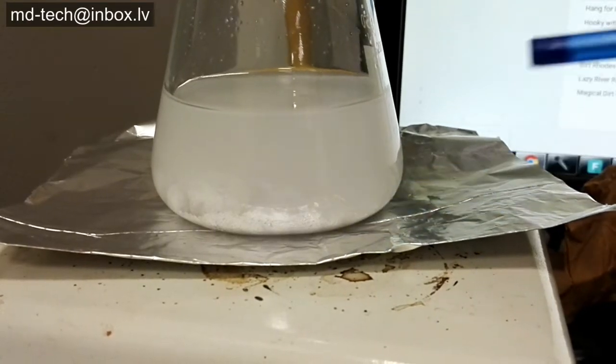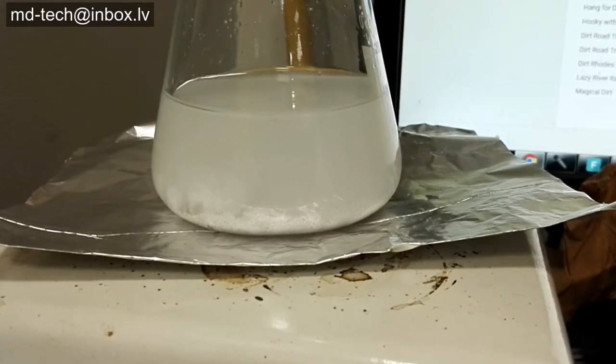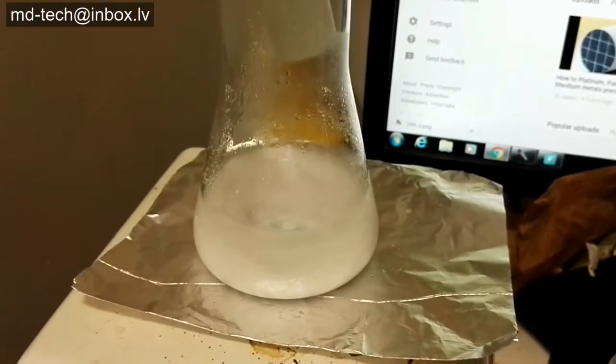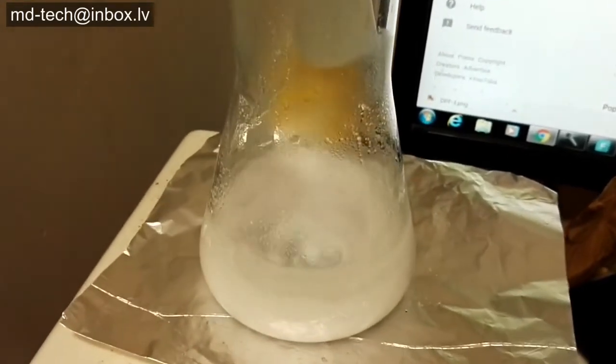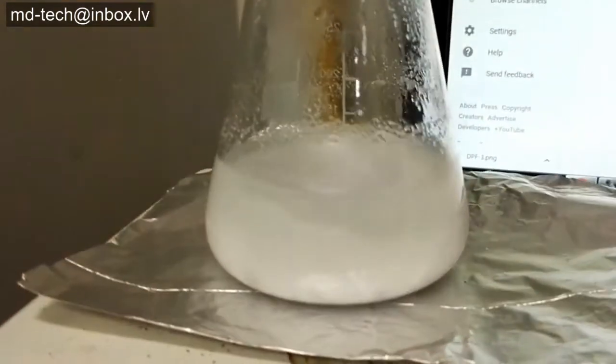Today I teach you how to recover silver from silver chloride. Very important is to boil silver chloride in distilled water minimum 5 times. Lead chloride is dissolved only in hot water — need to be sure no impurities remain in the silver chloride.